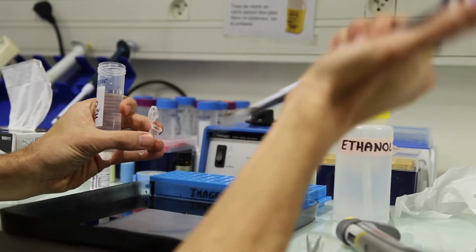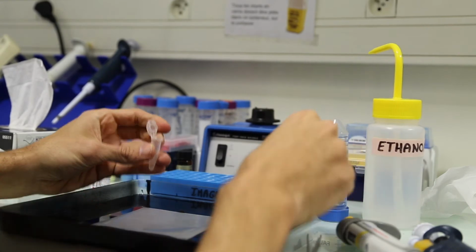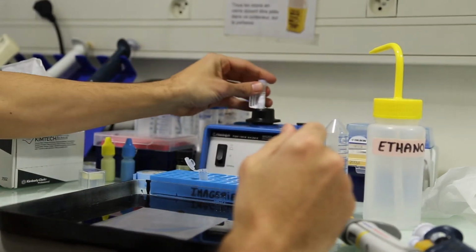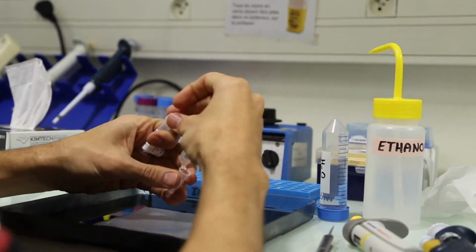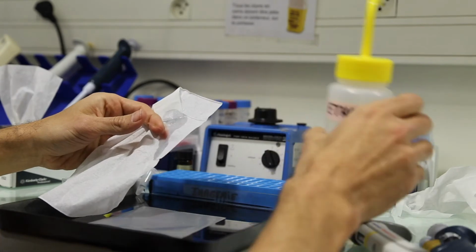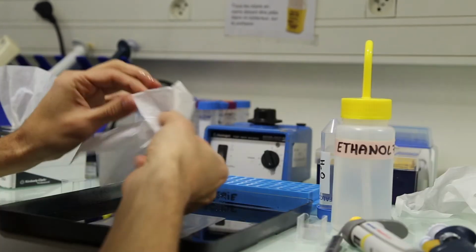Let's start by diluting the original bead suspension to a suitable concentration, around 10 to the power 9 beads per milliliter. The bead density is critical in order to find isolated beads in the center of the field of view of our microscope. We can vortex or even sonicate the bead solution to dissociate possible aggregates. Here we dilute the beads 300 times. Don't forget to clean the cover slide using Kimtech paper and 70% ethanol.